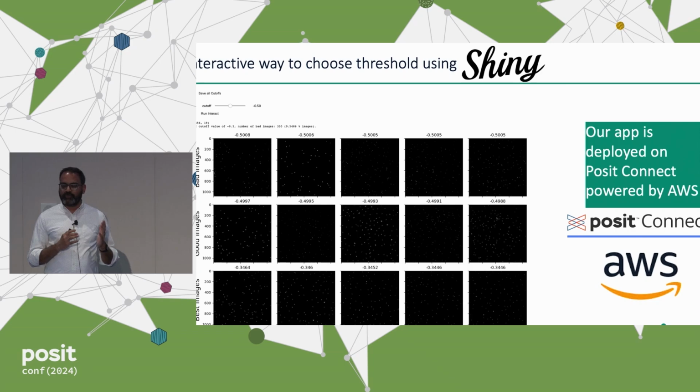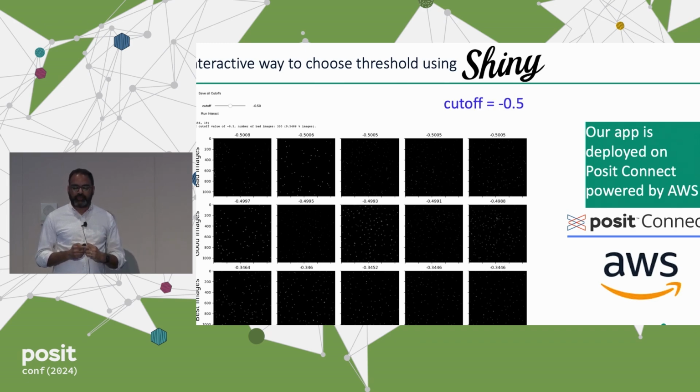So we have a tool like this. The interface looks like that. On the top, they can adjust the cutoff. And let me just walk you through what the interface looks like. It gives you a list of bad images on the top, good images in the middle, and the best quality images at the bottom. And this is starting off with the automatic threshold. You can see there are some images on the top where some images have cells, some images have nothing in them. So these, you do want to catch those.